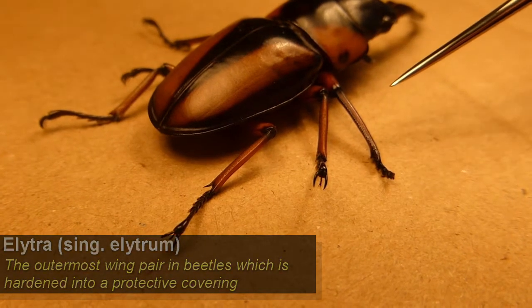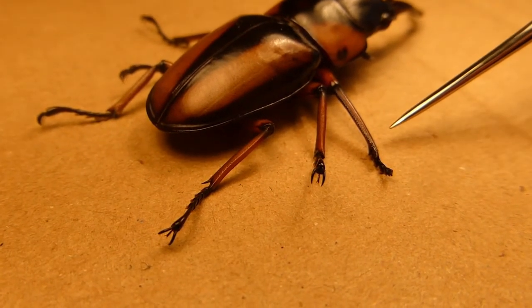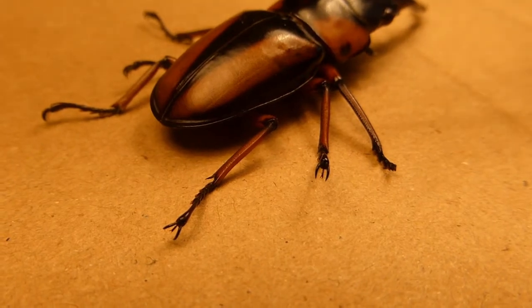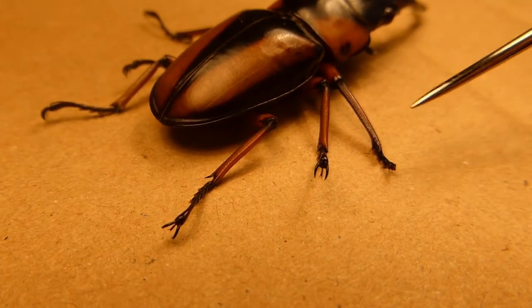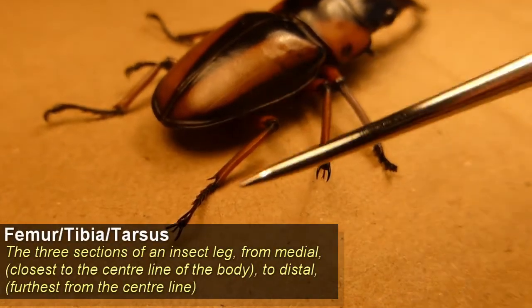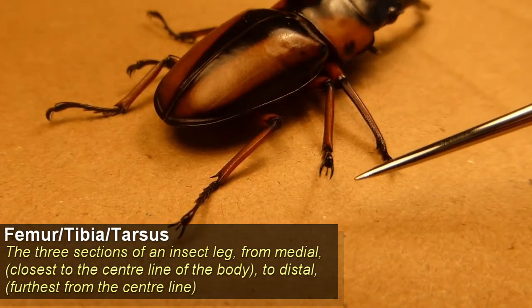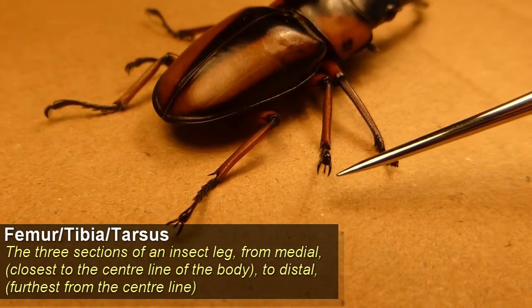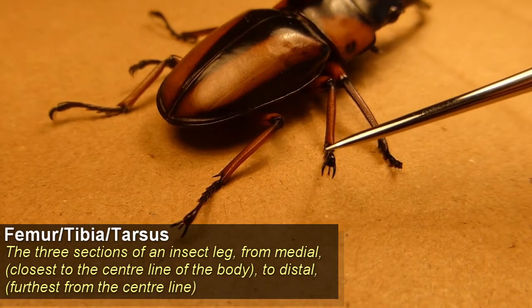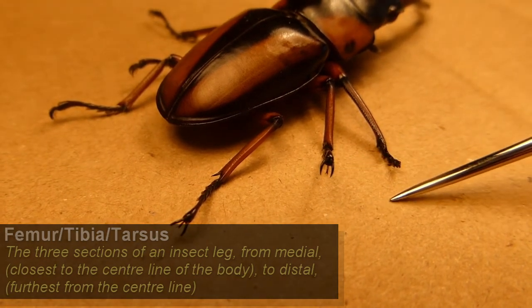As far as the legs go, we have the forelegs, the midlegs, and the hindlegs. Each leg is separated into three sections: the femur, the tibia, and the tarsus. The tarsus at the end has these claws here. In this species you can see it has these two big claws and one dainty little claw underneath.